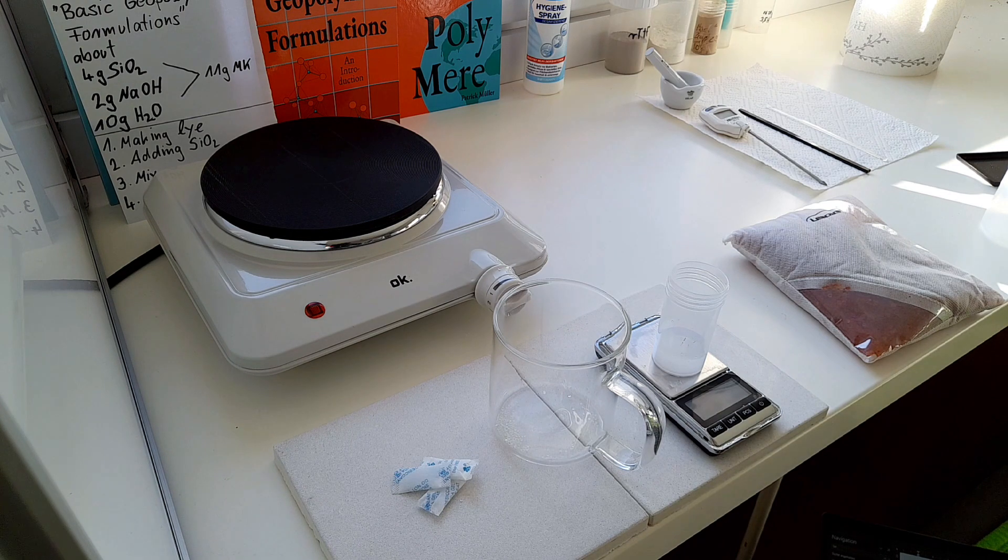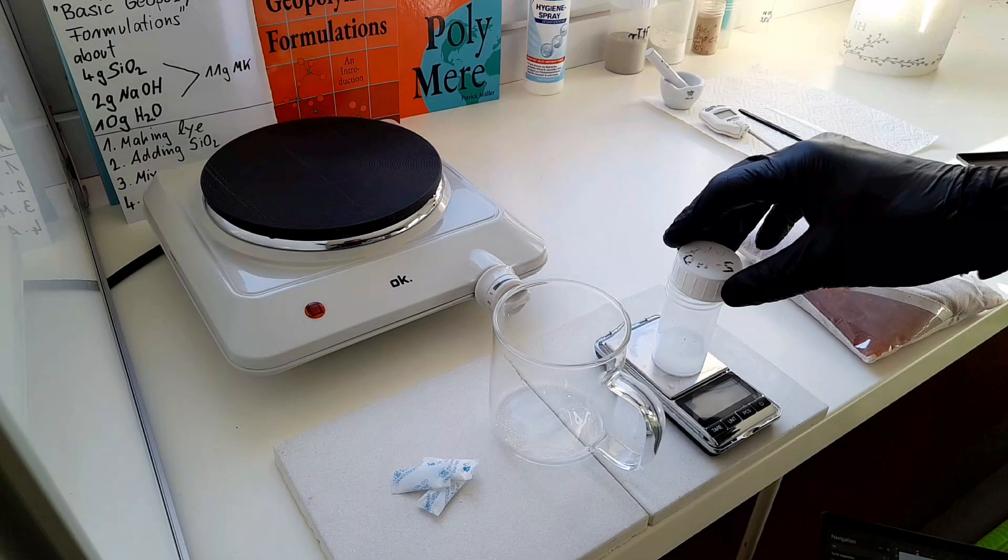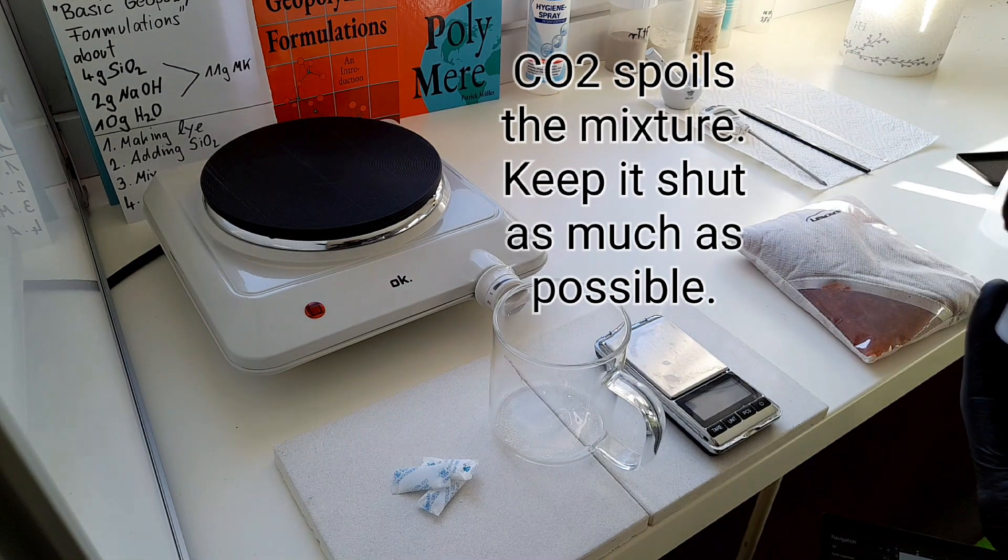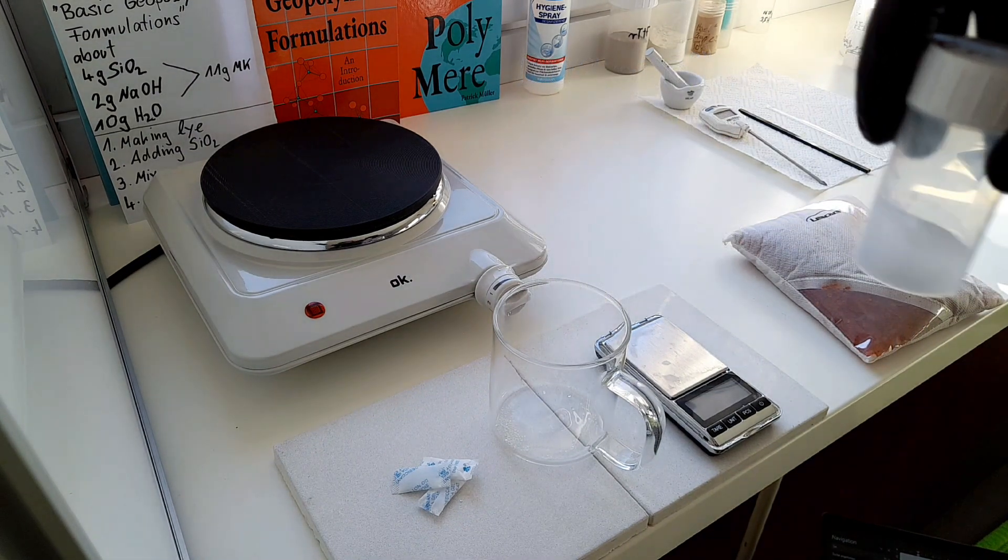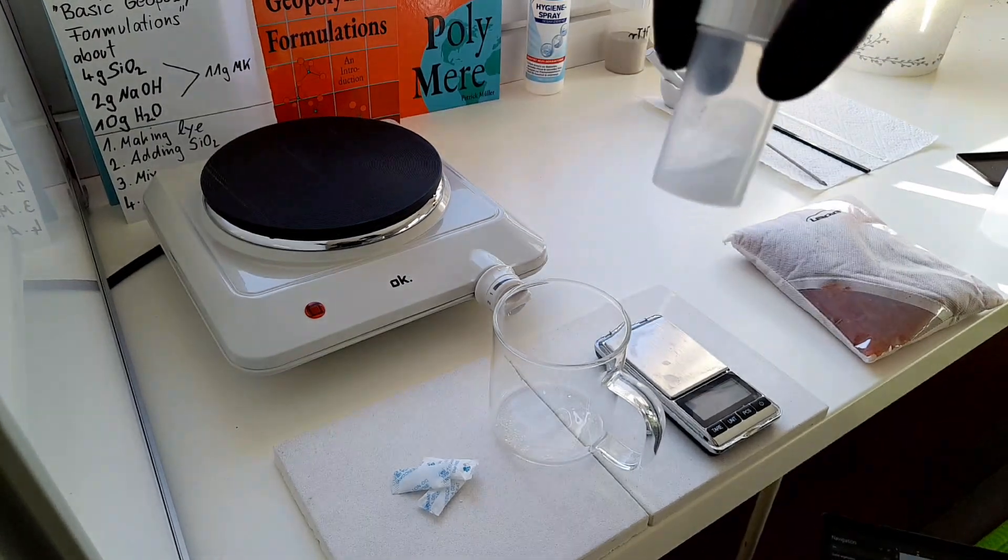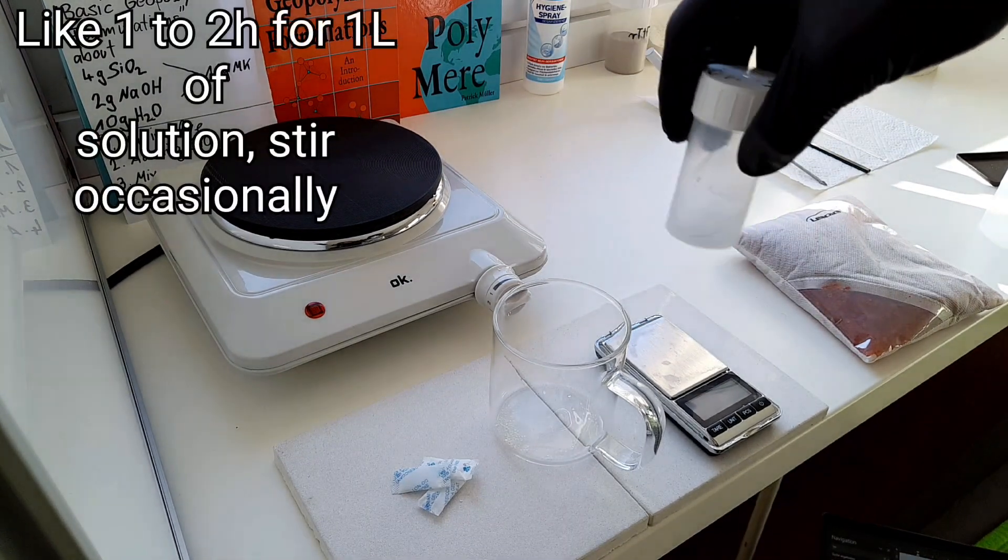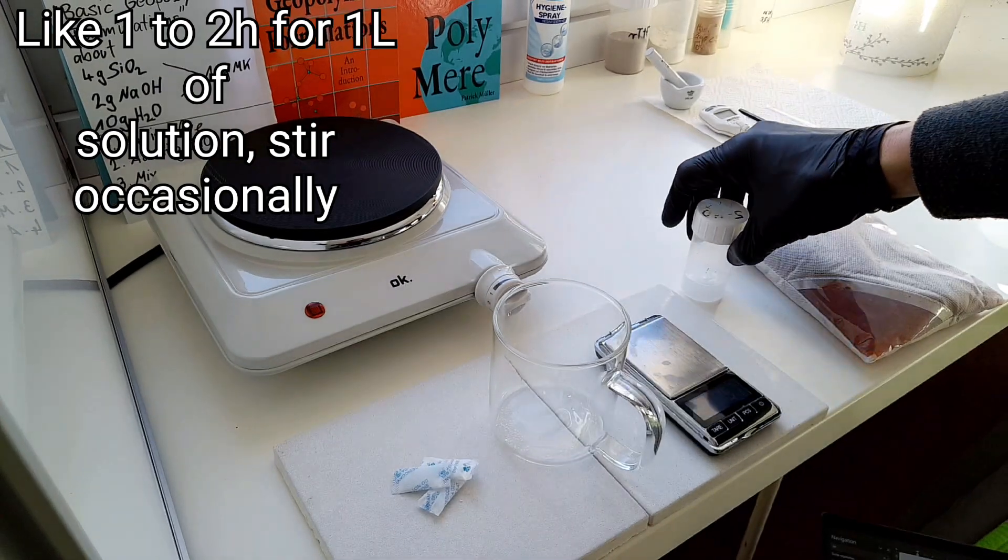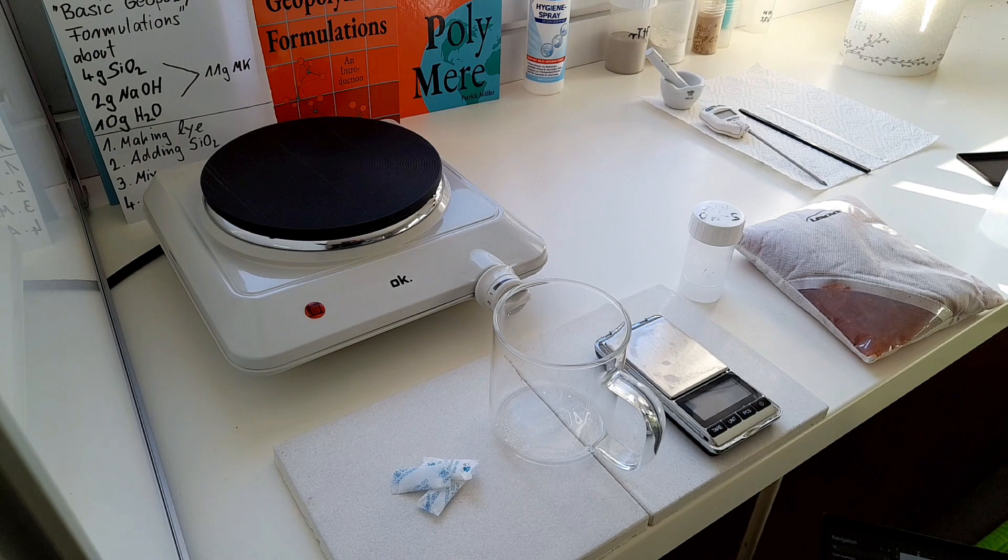Fantastic. Now I close the lid because I don't want it to get in contact too much with CO2. Normally you really need to give it some time to dissolve, but this is a very small amount and that makes fewer problems.